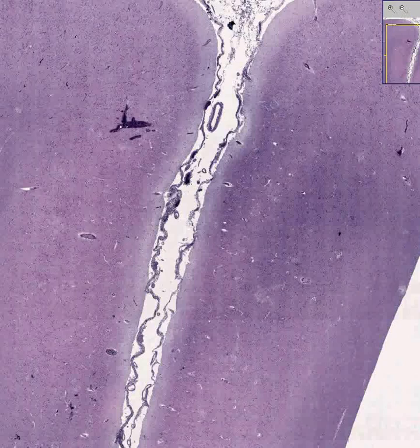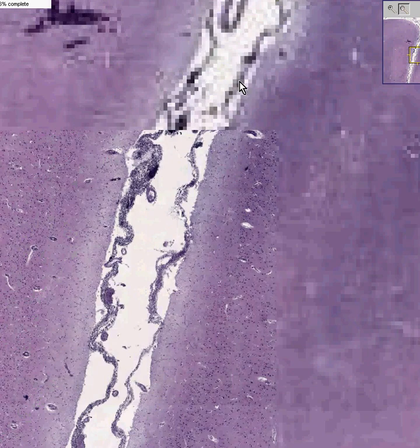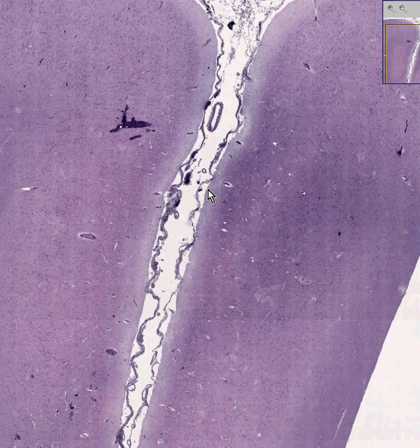The pia mater technically is just a couple of cells thick, and it's not really grossly seen, and it basically covers every tiny little nook and cranny of the surface of the brain. And I wish we weren't stuck in a traffic jam here, but it looks like we are. The pia mater might possibly be seen as just a couple of cells along here. All the rest of this is arachnoid, and so much for the meninges.